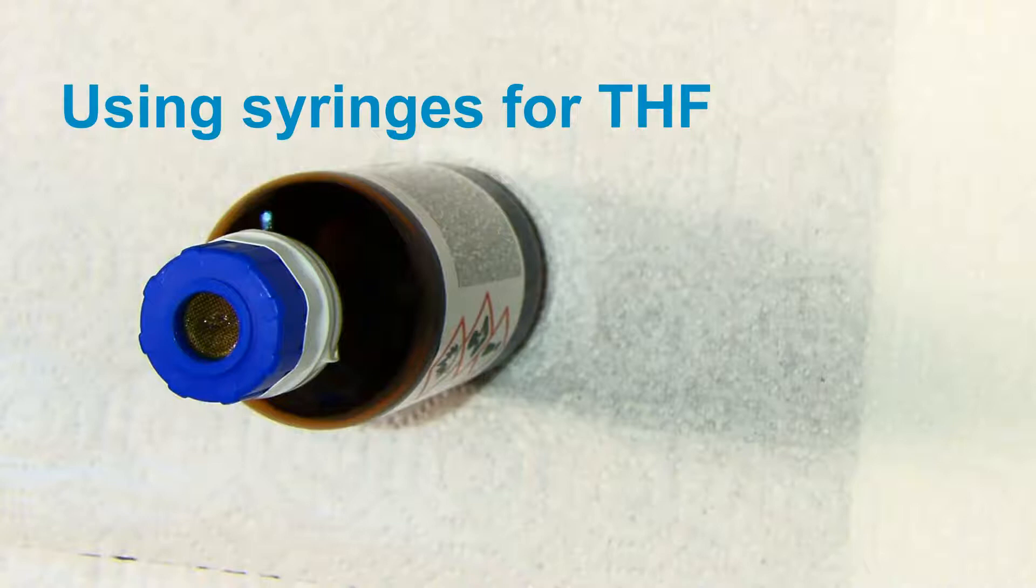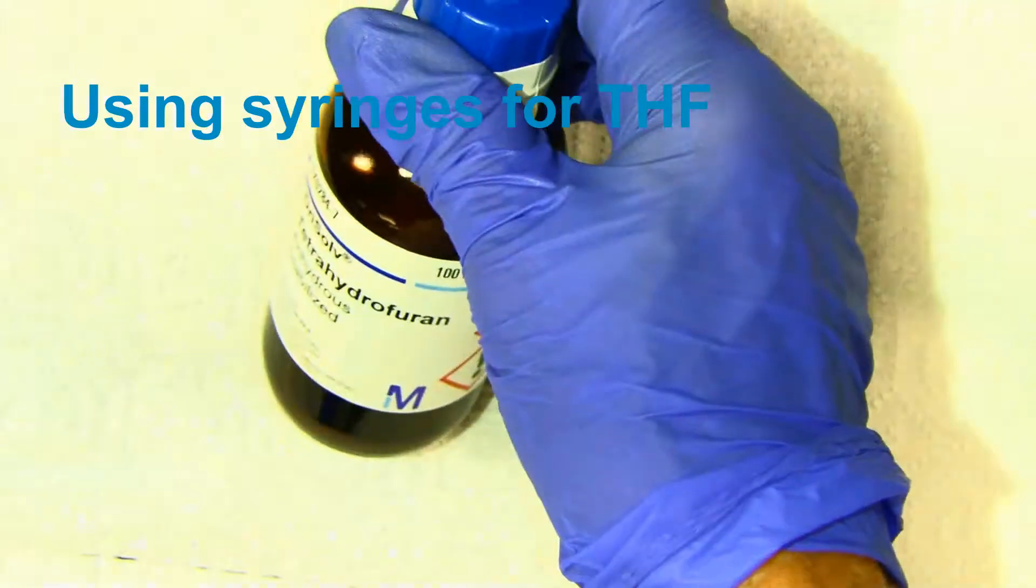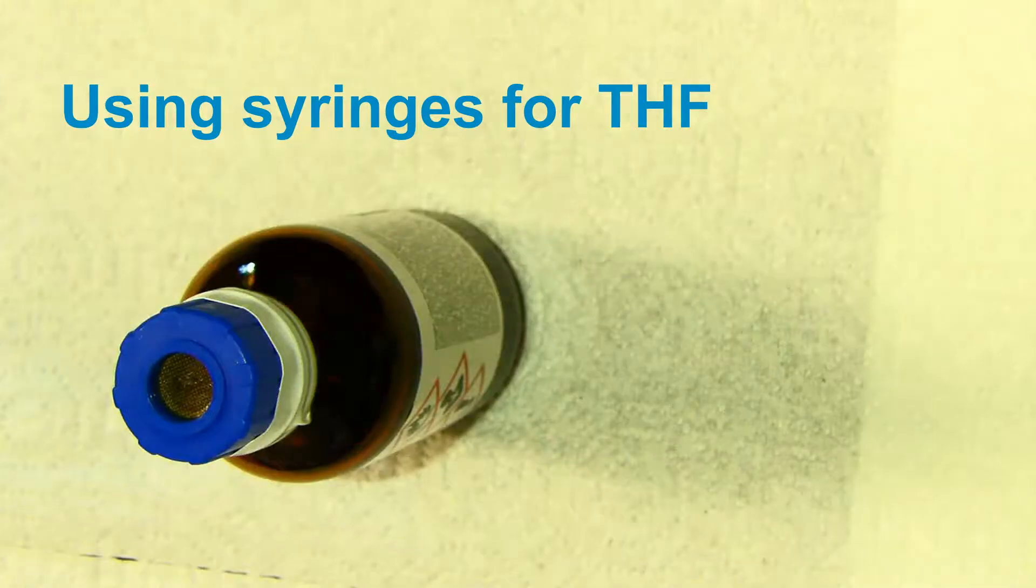The specially dried anhydrous THF, that's tetrahydrofuran, is in a sealed bottle under a dry atmosphere. So the cap should not be removed, but the needle of the syringe can go through the cap's septum.